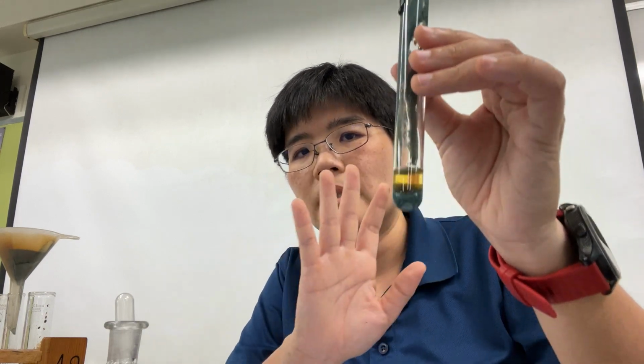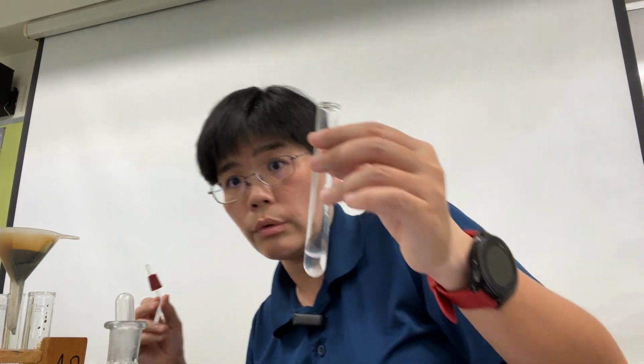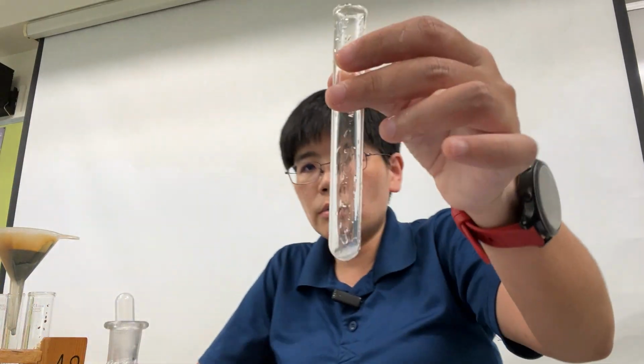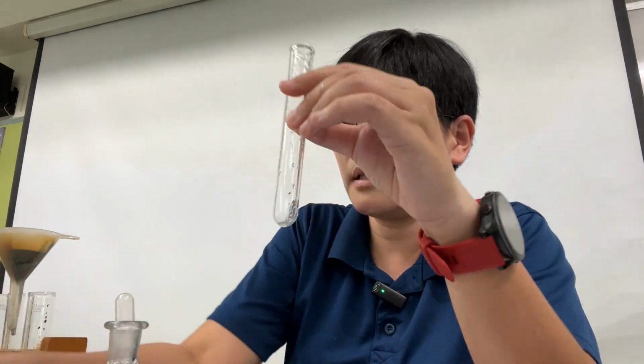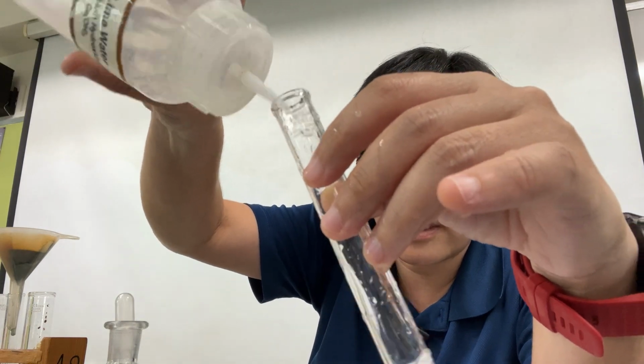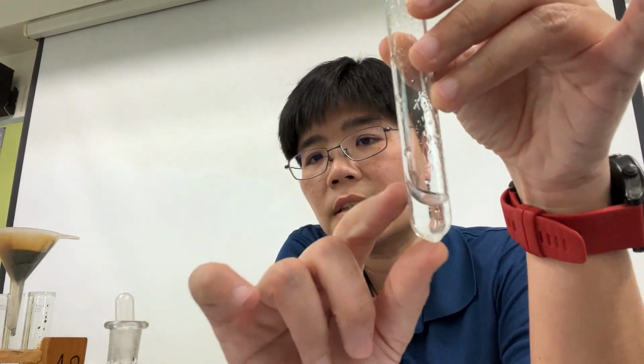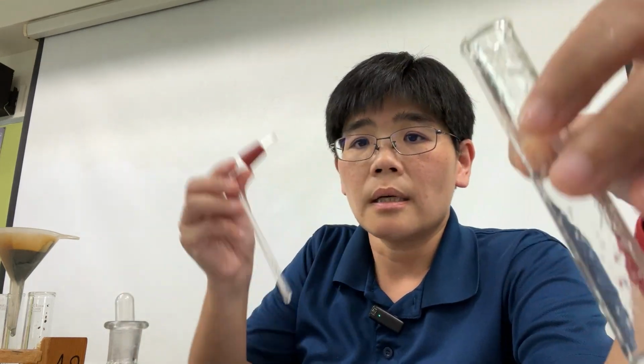So I'm going to leave this to stand. I'm not yet done with this part. I'm going to get ready the lime water again and then test. So this was the tube I used just now. I'm going to wash this and use it again. So to this tube, now, I will add in some more lime water, and then I'll add about this volume, about 1 to 2 cubic centimeters, no more than this. This is good.